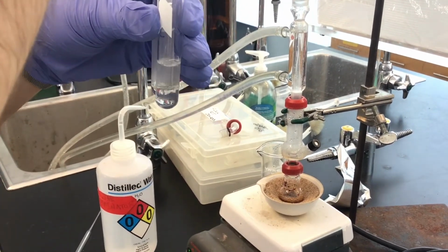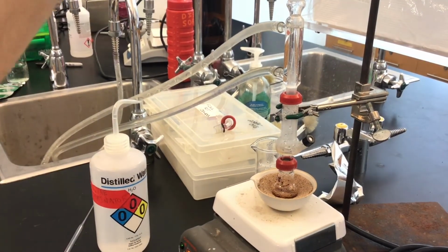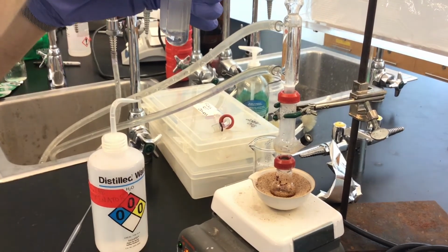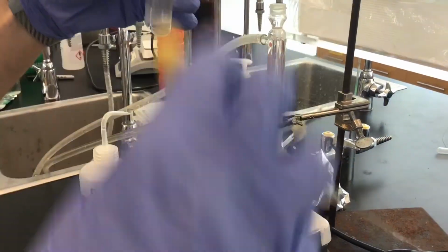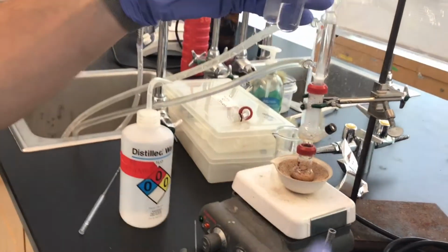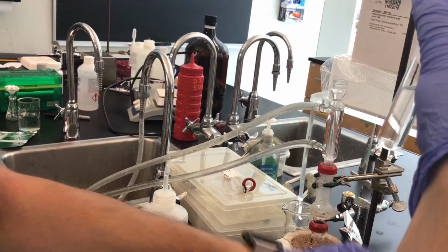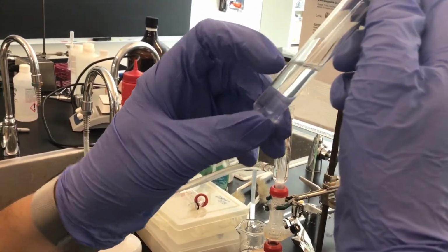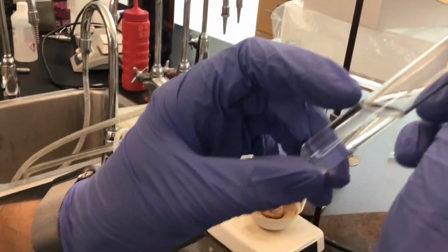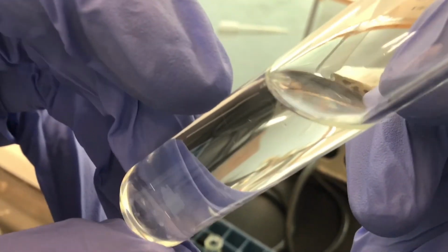Third, and so this is the final extraction, and I've got my combined organic layers. So I was very careful, trying to avoid any water from transferring over. However, there's still going to be water that we cannot see. So if we were to see water, we would see it on top, and typically it tends to stick to the glass. So I'm not sure if the camera can capture this well enough, but there are little water droplets floating on the surface of the methylene chloride.